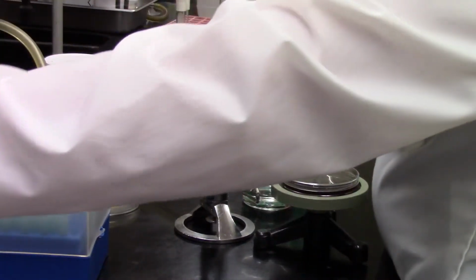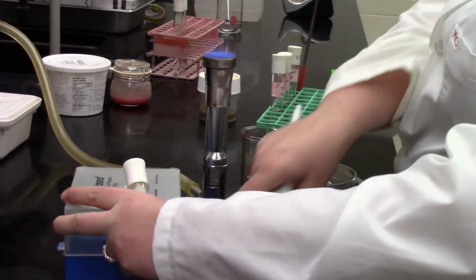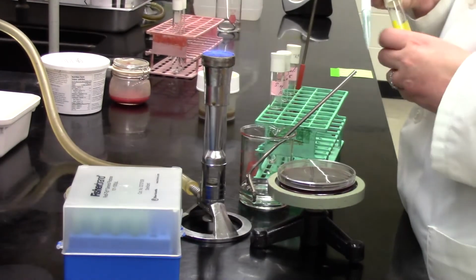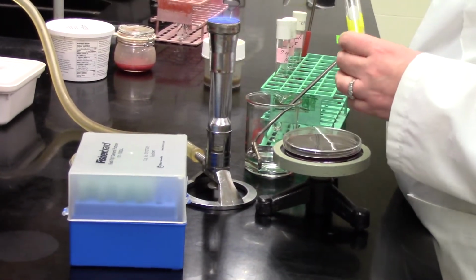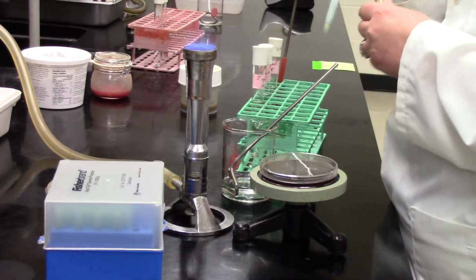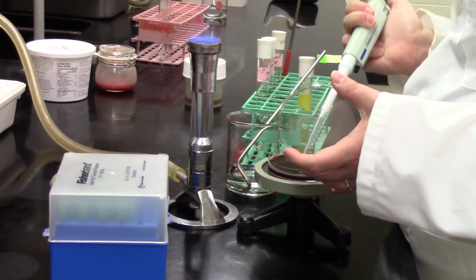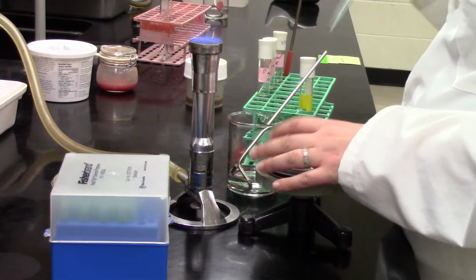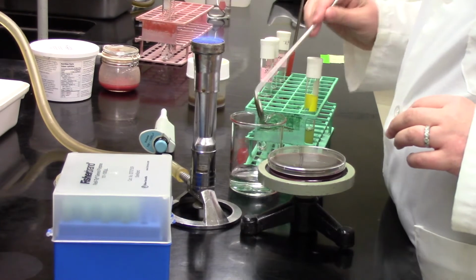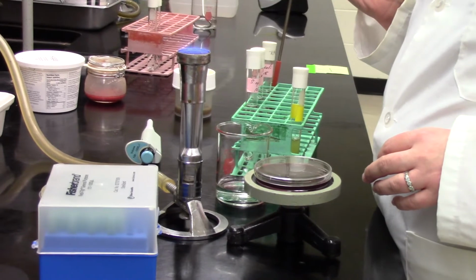Okay, so we're going to vortex. There's the hand going across. You can hear the vortex going. You can see how Sabrina's really careful to shut that box of pipette tips every time. If you're pipetting anything in the microbiology lab with those pipette tips, you want to keep those as sterile as possible. They've all been autoclaved, but you want to open the box for the briefest amount of time possible and shut it as quickly as possible, and also keep it close to that flame, working in what we call the sterile zone.